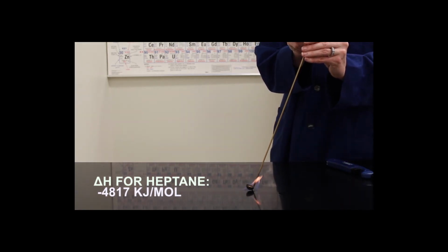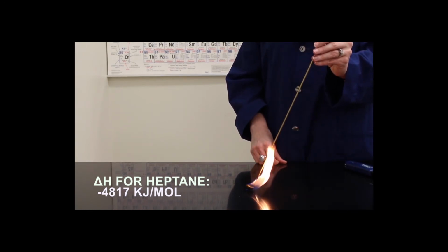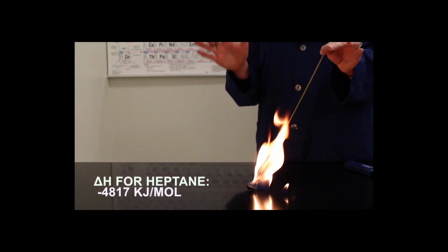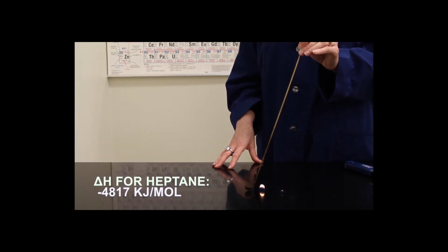This larger flame is indicative of a larger heat of reaction, and you can start to see that there's a very large flame and it's a very sooty flame, which means it's not as clean burning.